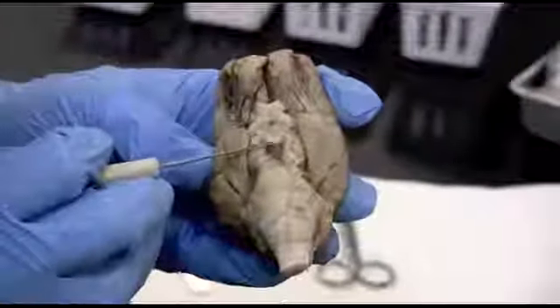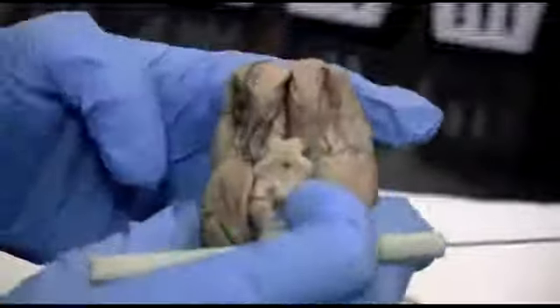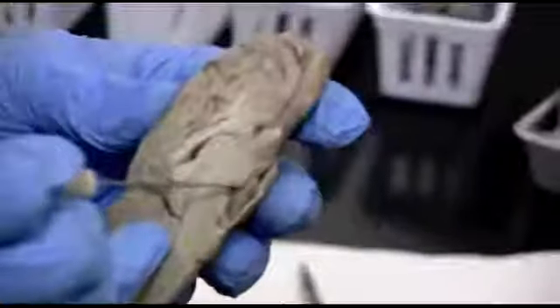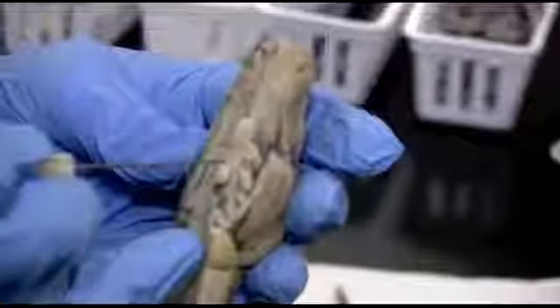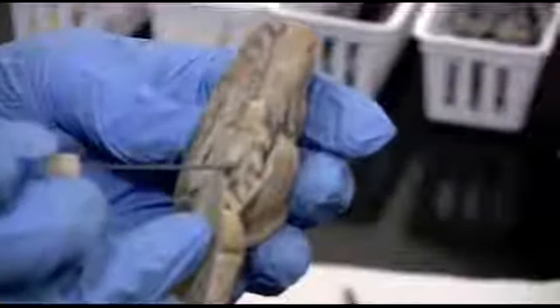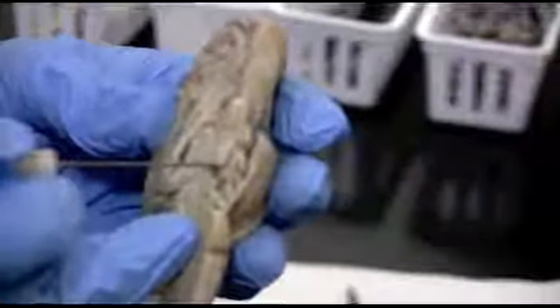So these mammillary bodies, it's kind of hard to see right here, but after we cut into the brain, let me go ahead and show you what it would look like. This little round piece right here is the mammillary body, and that would be the posterior border of where the hypothalamus is.